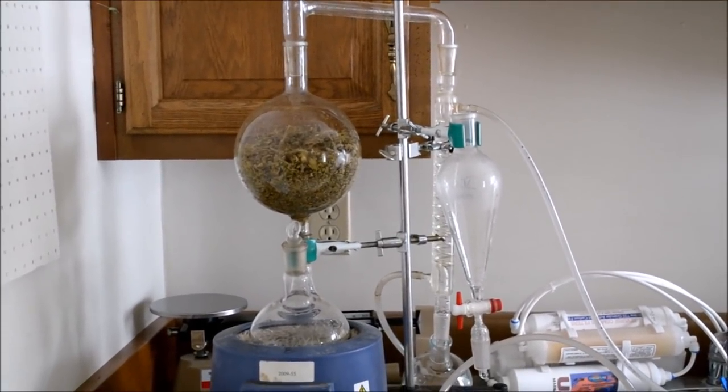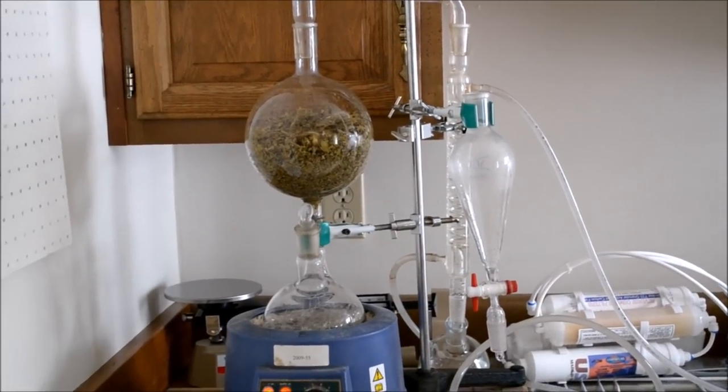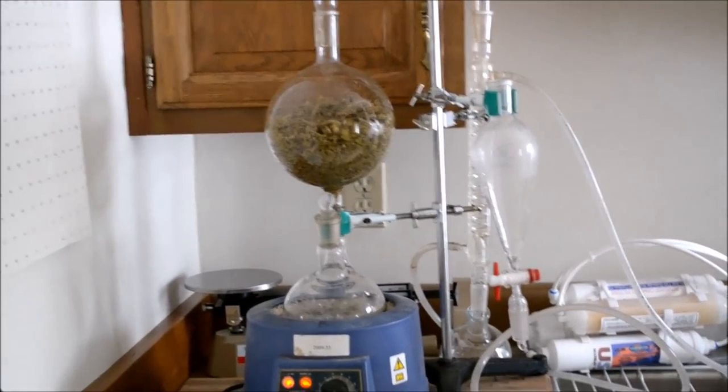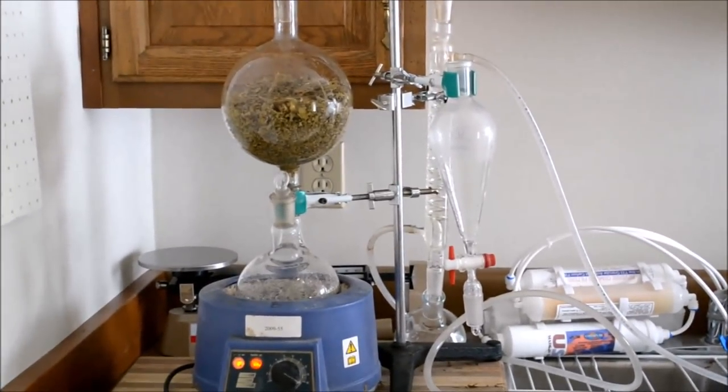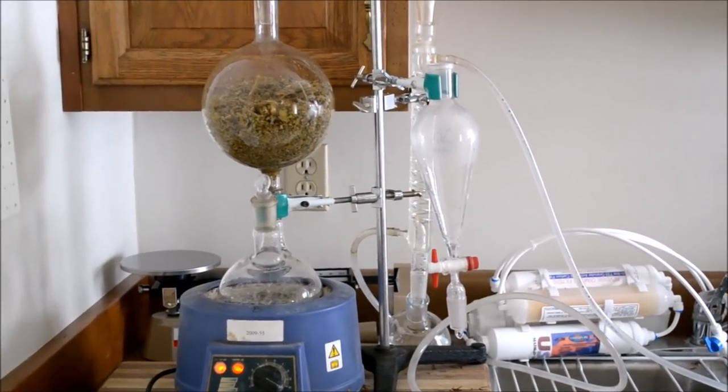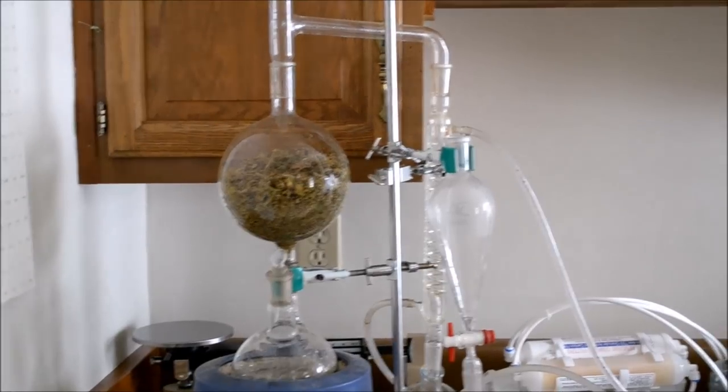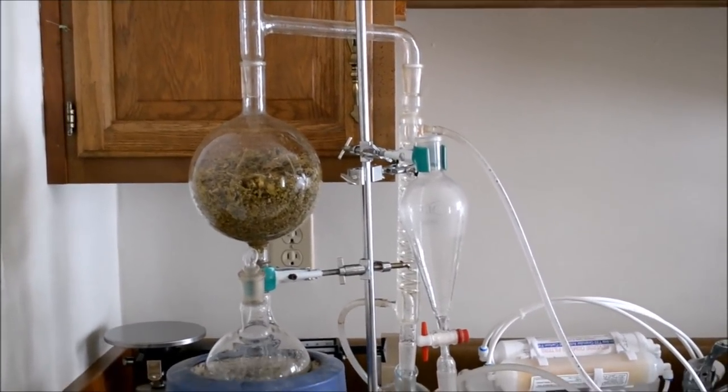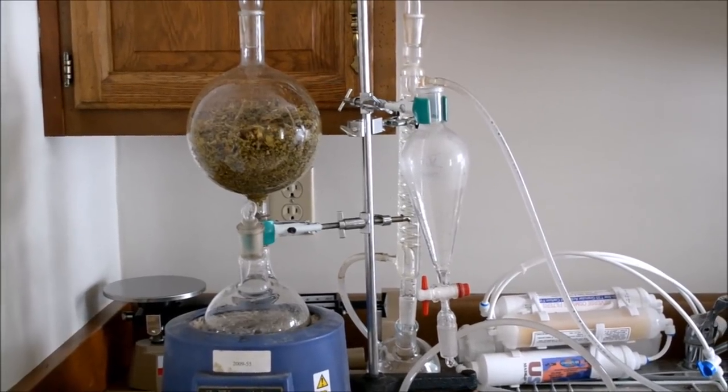Hello everybody from Aromatherapy 101, this is my module 3 project number one for discussion. What I wanted to do for you guys is make a short video about exactly how to distill essential oils. What we're looking at right now is my still, and this is essentially a standard chemistry set.